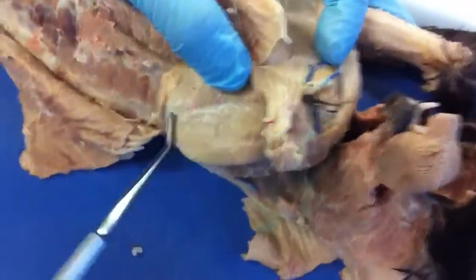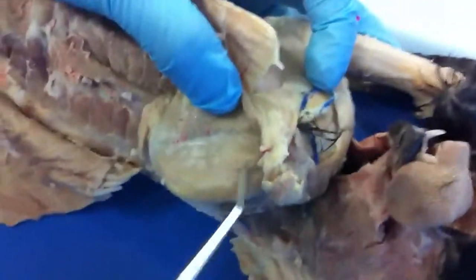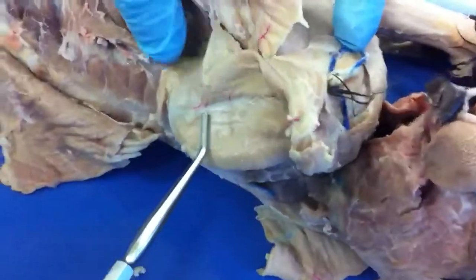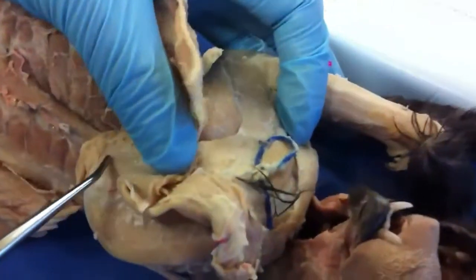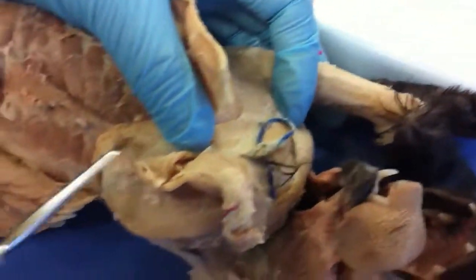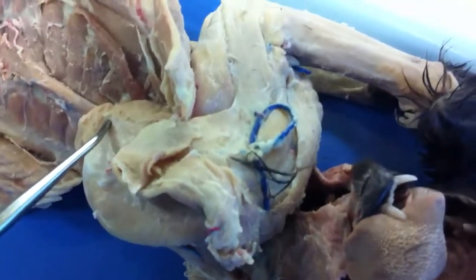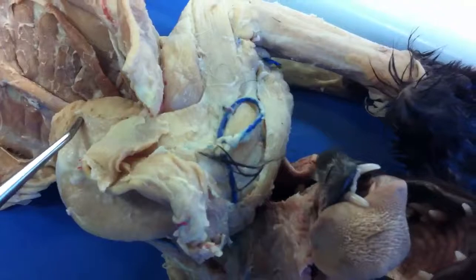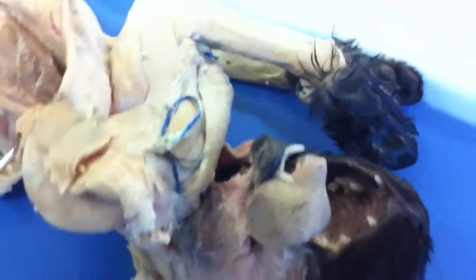The supraspinatus — 'supra' meaning above — is on the scapular spine. The infraspinatus is the one on the lower part of the scapula. We also did the rhomboideus and serratus ventralis, so I think we got pretty much everything.